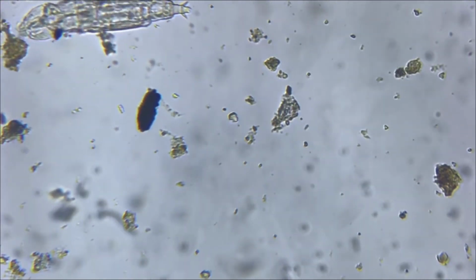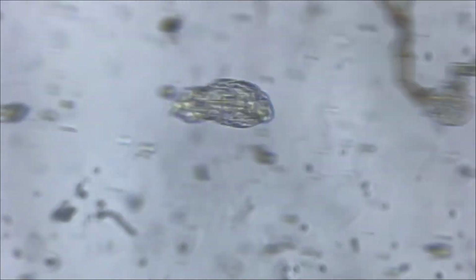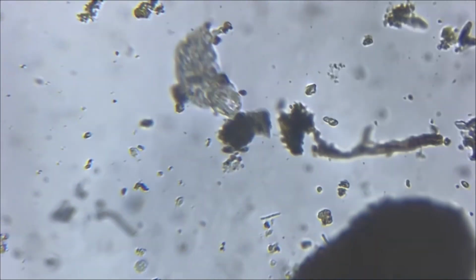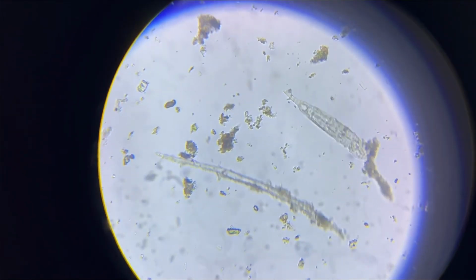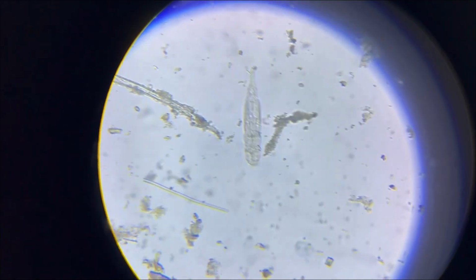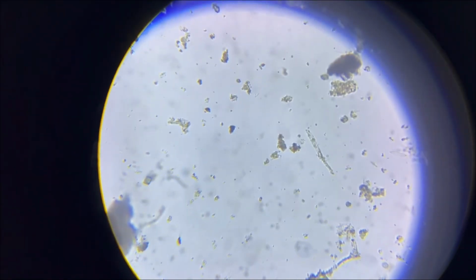So as we move through water, we think of it as something that's quite easy. However, when you're incredibly tiny, water tension is something that you have to take into consideration. Water's actually sticky. So these little microbes have to take into consideration the stickiness of water when they move, and you can see that this little maggot is using the stickiness of water to move itself around, moving around like a little accordion.